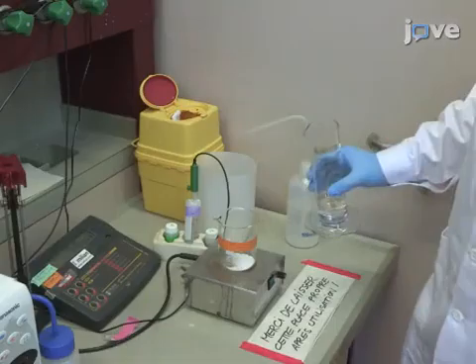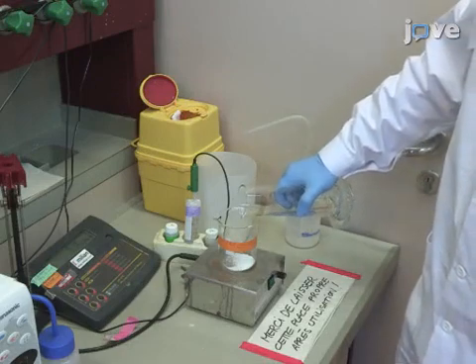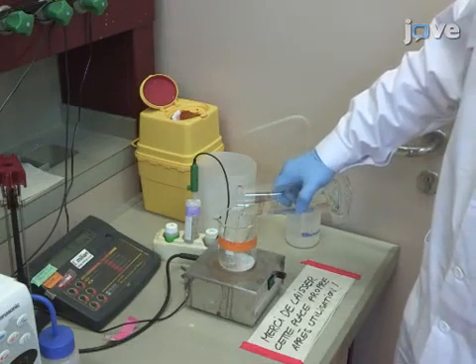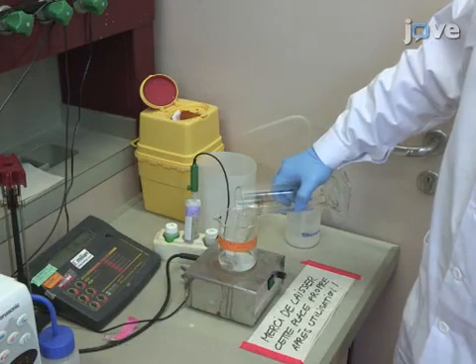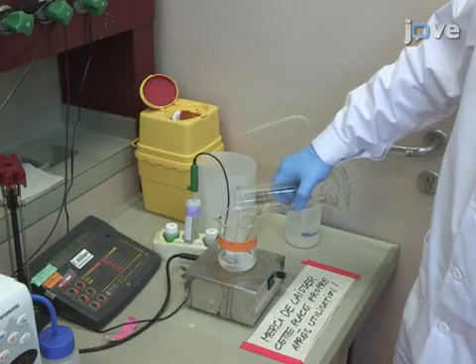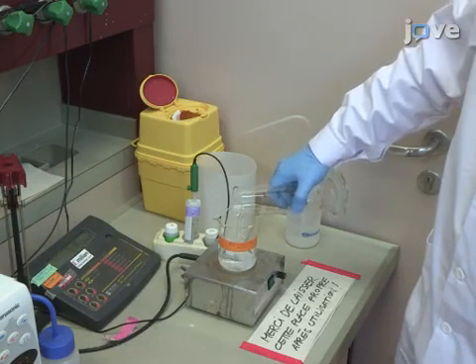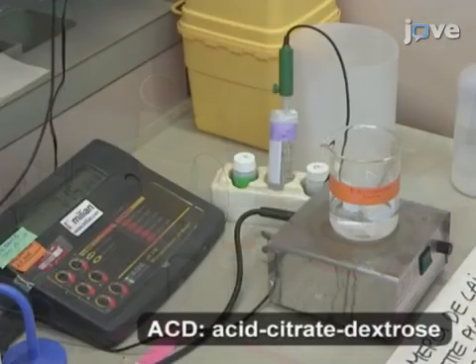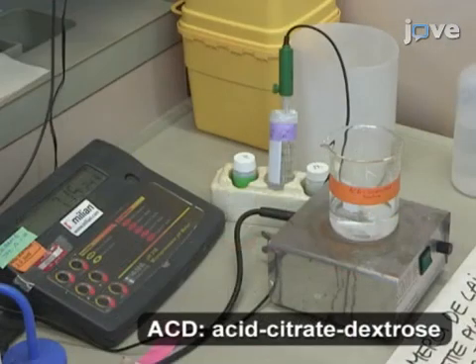To begin, dissolve 1.4 grams of citric acid monohydrate, 2.5 grams of trisodium citrate dihydrate, and 2 grams of anhydrous D-glucose in distilled water to prepare 100 mL of an ACD solution with a pH of approximately 4.5.